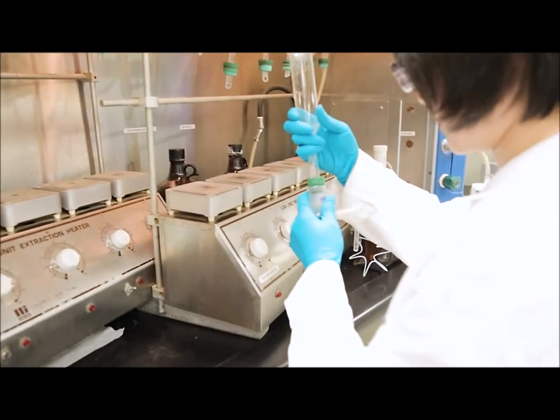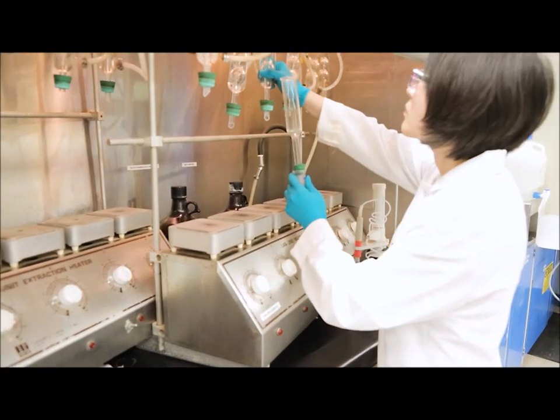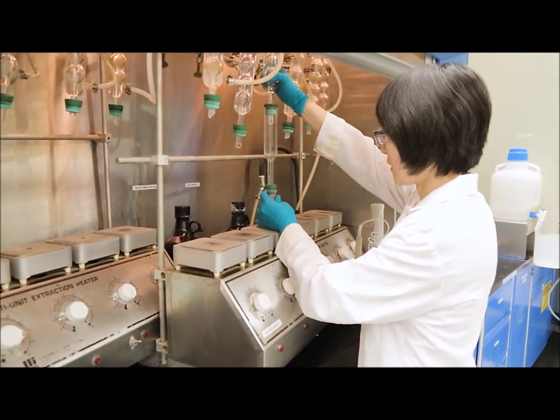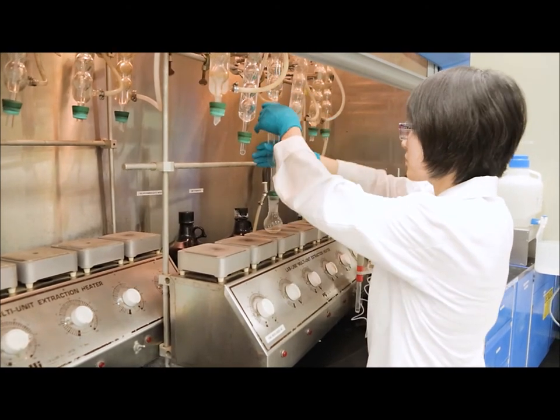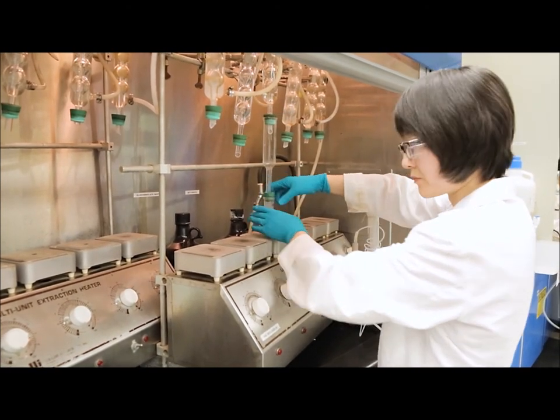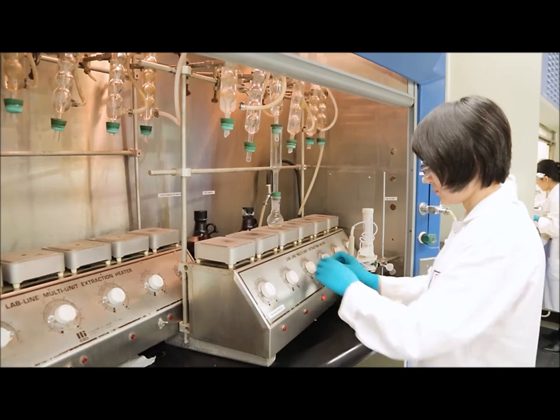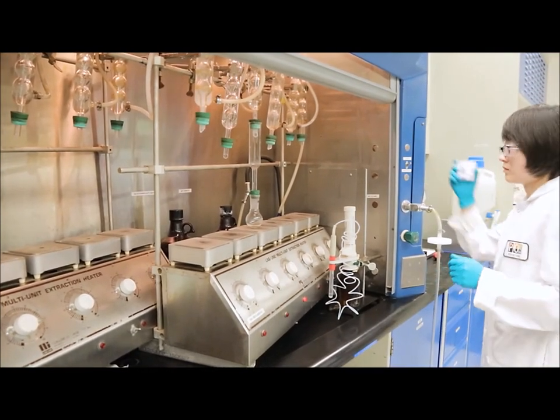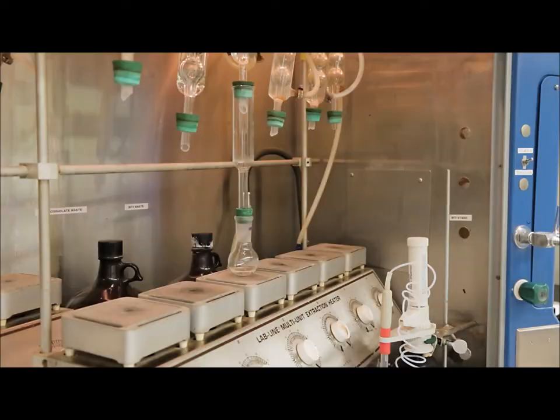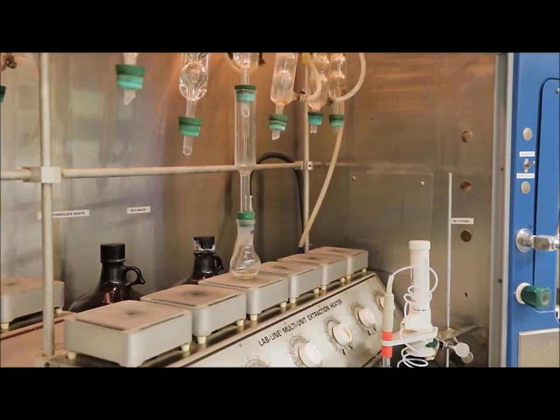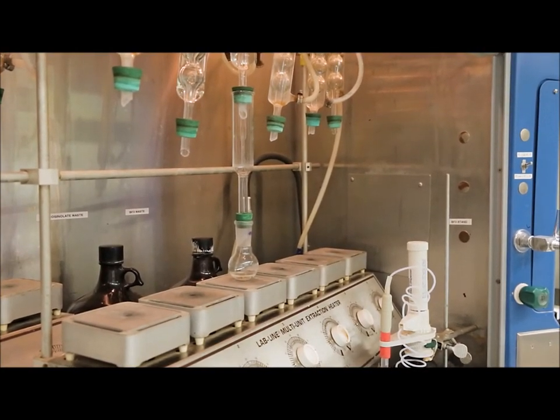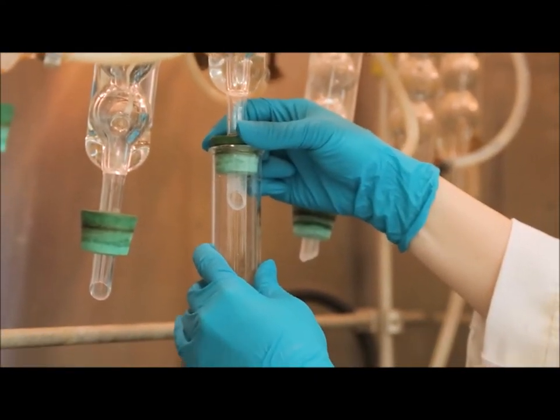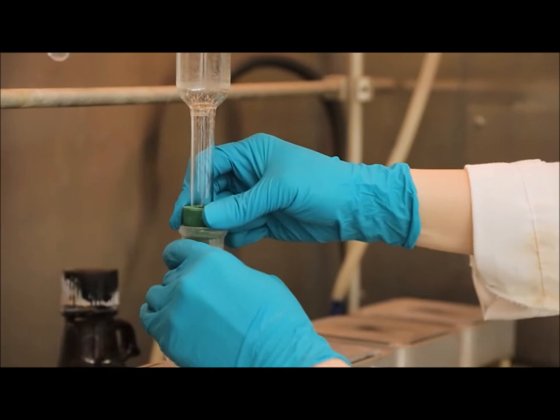Now we are going to attach the boiling flask to our apparatus. We use a connector to attach the boiling flask to the condensers. The condensers are going to have cold water flowing through them and the heating pad is going to be turned to high temperature. It is important to allow the sample to boil for at least 20 minutes.